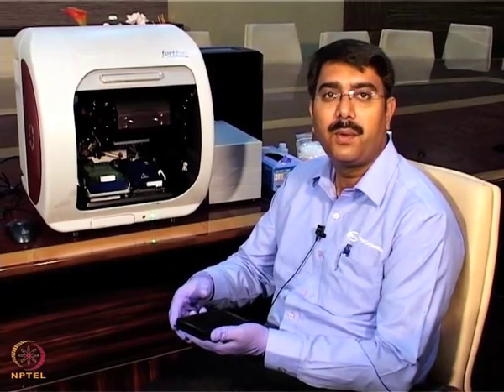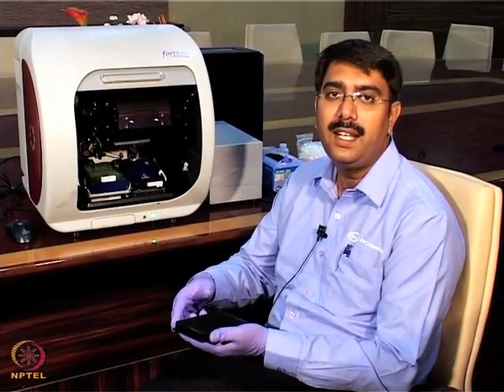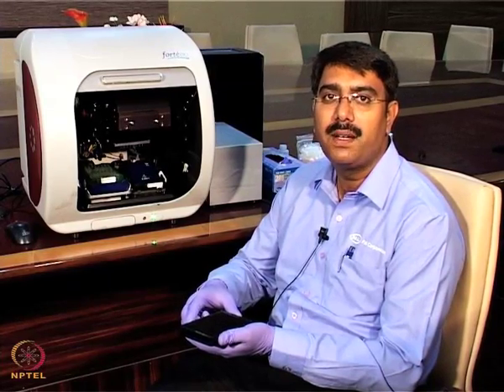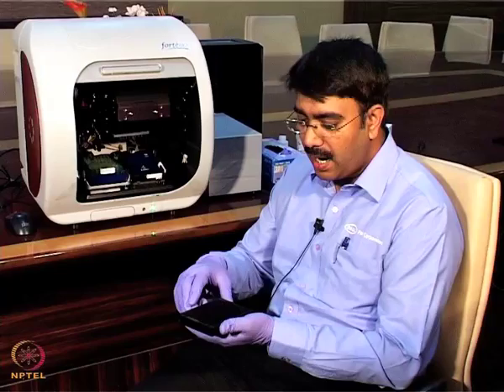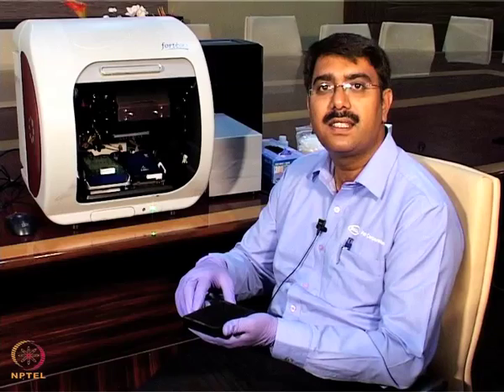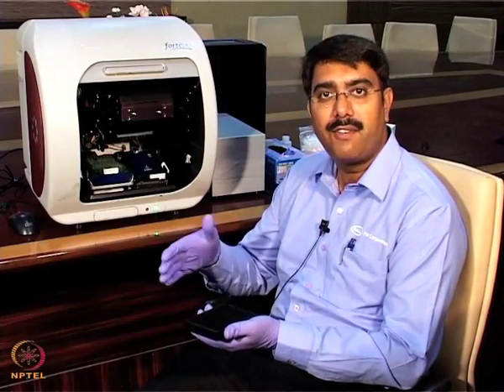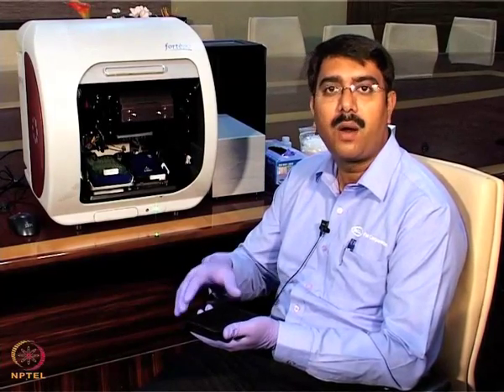I am going to demonstrate the kinetics interaction of the mouse monoclonal antibody to the protein A ligand. Here I am using biotinylated protein A as a ligand. At the concentration I am using 10 microgram per ml. I am putting 10 microgram per ml into the 6 wells, and I am using mouse monoclonal antibody as the analyte. Here I am taking the starting concentration at 25 microgram per ml. I am going to do a two-fold serial dilution from 25 to 12.5, then serially go for two-fold dilutions, around 6 data points.